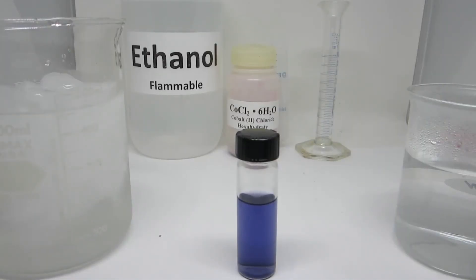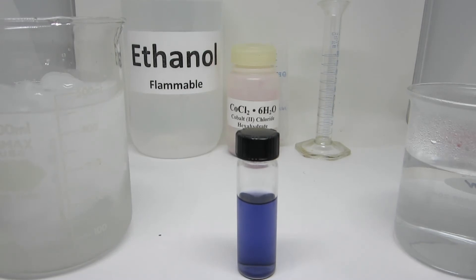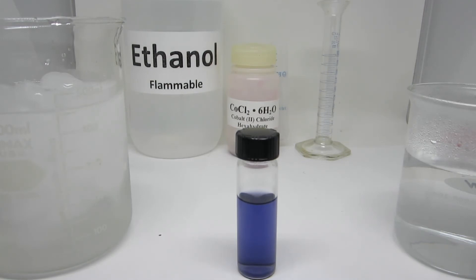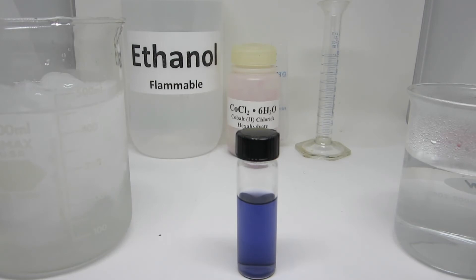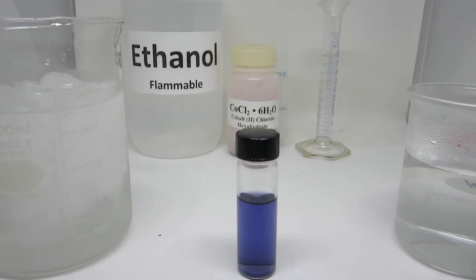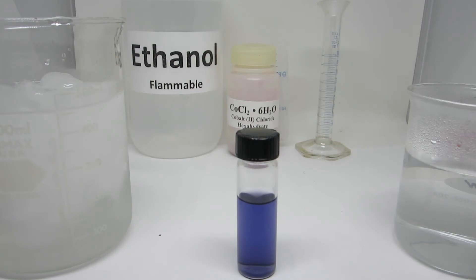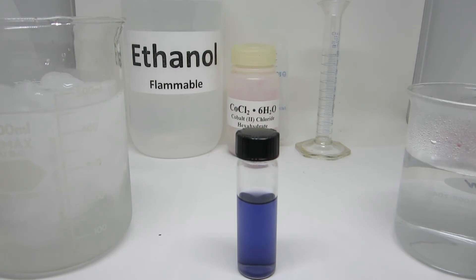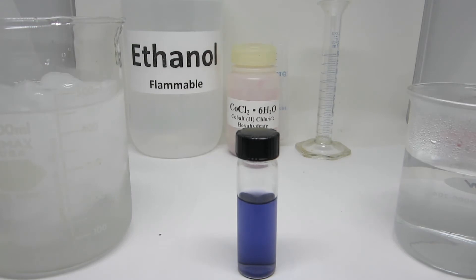Not only can solvent play an important role in an equilibrium reaction, but the temperature of the reaction can play a role as well. In this experiment, we will look at the concentrations of both the cobalt-tetrachloride complex, which is blue, and the cobalt-hexa-aqua complex, which is red. Using a spectrophotometer that was simulated in the first experiment, we can compare to known samples and get accurate concentrations of these pure substances at each temperature.